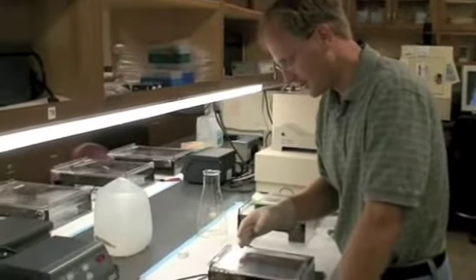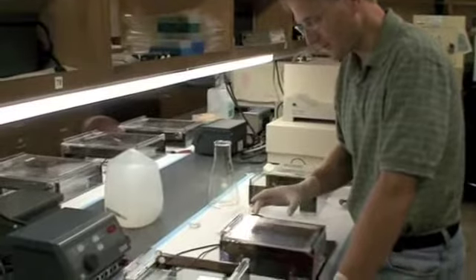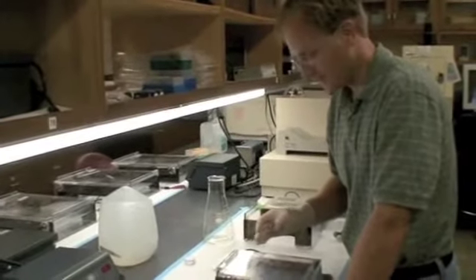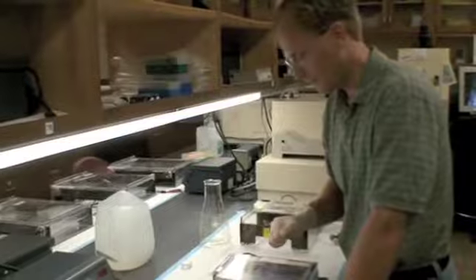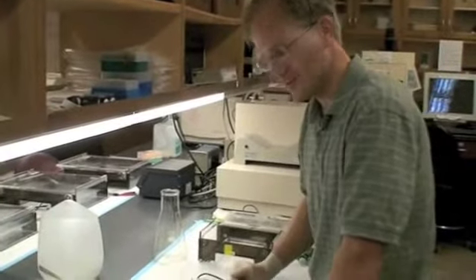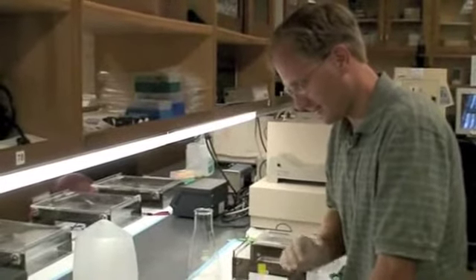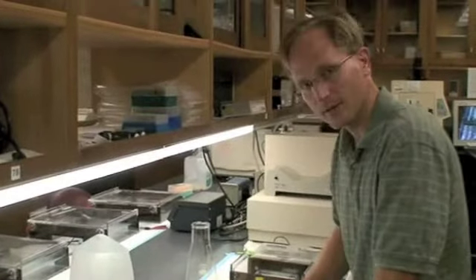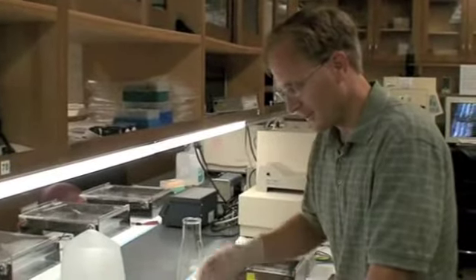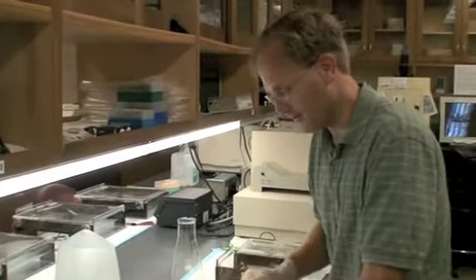Well, what we're going to do is let it run for about 40 minutes, and then we'll come in and check it. And it's always a good thing to stay here and just, it only takes a minute or two to verify that everything's right. You don't want all this hard work that you've done to go down the drain, literally into the buffer.